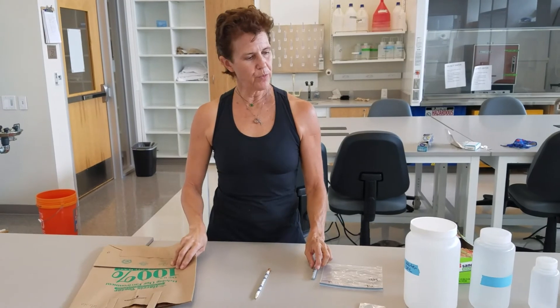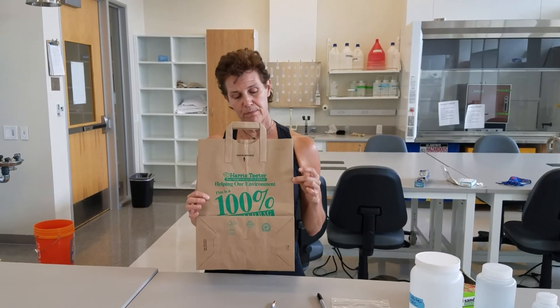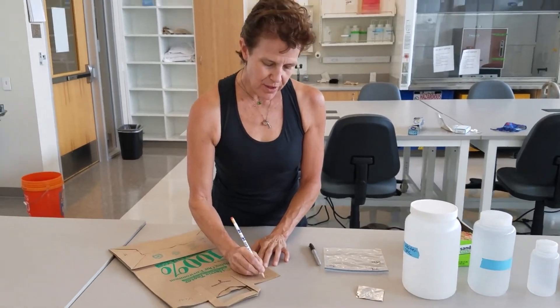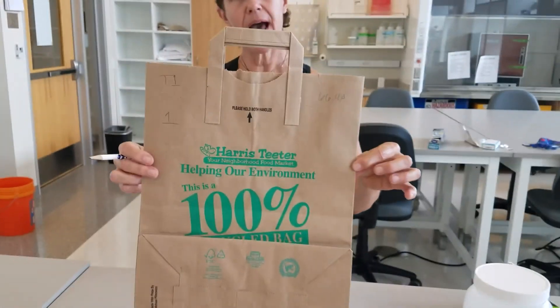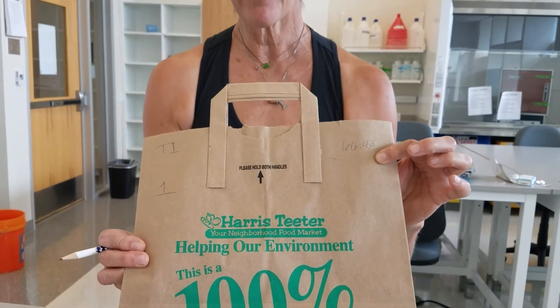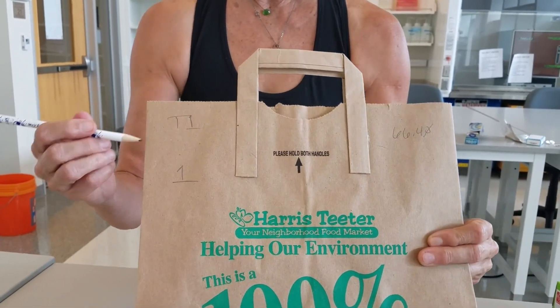The last type of sample we need to bring back to the lab is above-ground biomass. I pre-weigh the bag and then label it with the transect number and sample number. I use pencil for these bags because if they get wet, Sharpies have a way of fading. I've got a pre-weighed bag because I'm going to subtract that from the total weight of the bag after the sample has dried — this is a vegetative sample, labeled with the transect and sample number.